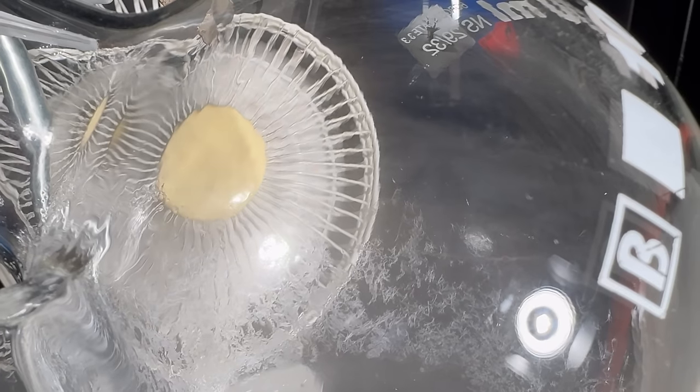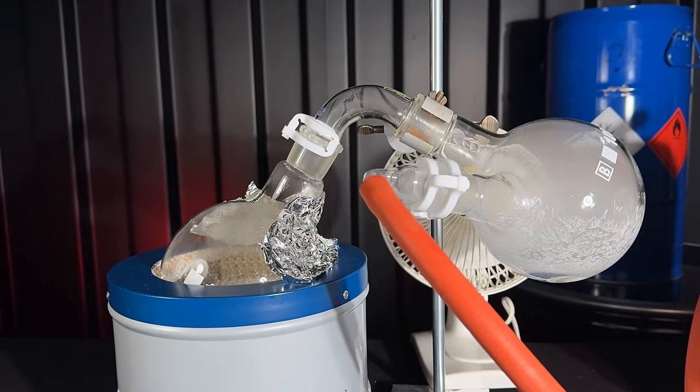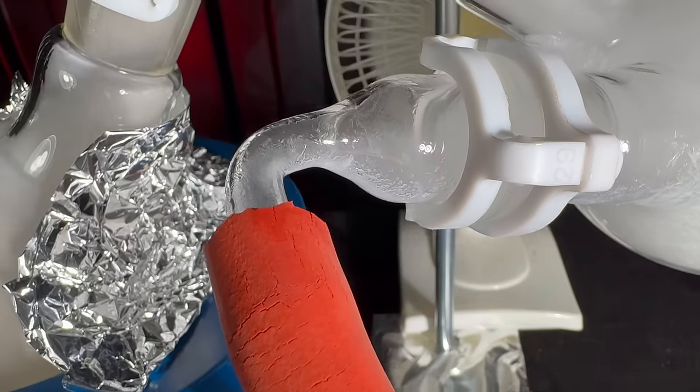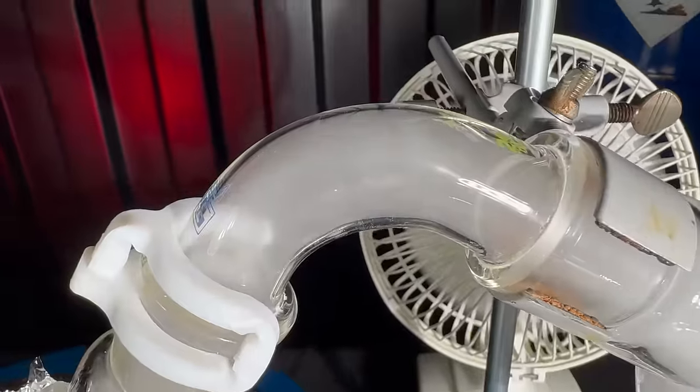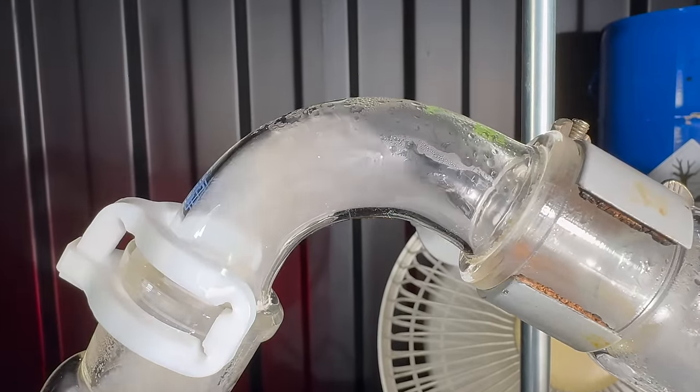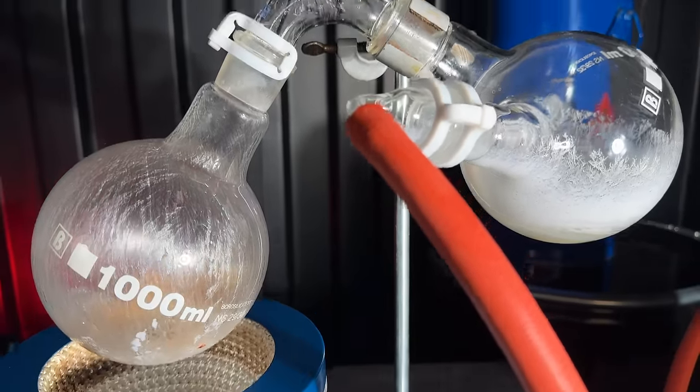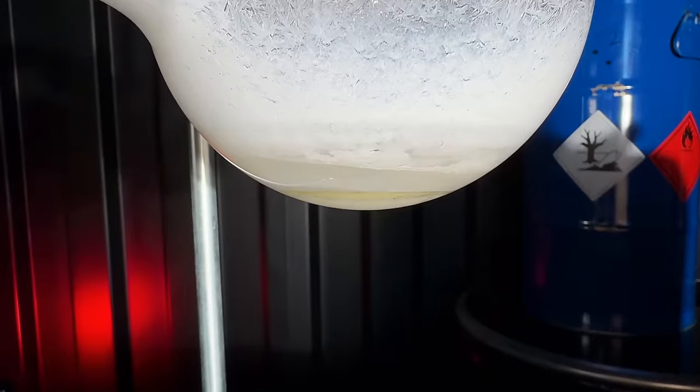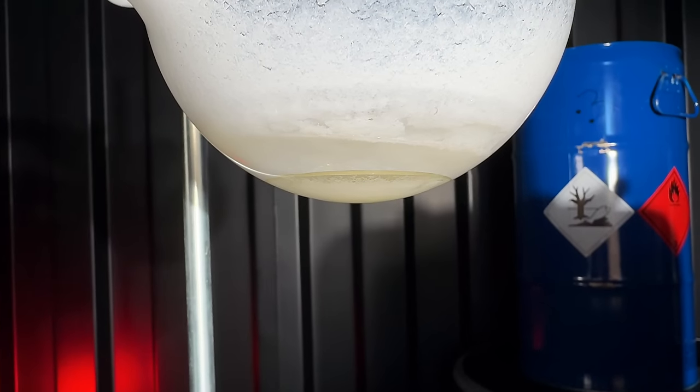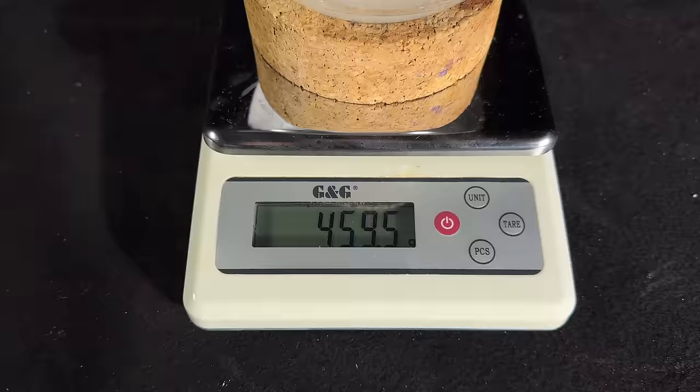The phenol cools down in the air, crystals form and you get this mesmerizing effect. It's like a snow globe in a round bottom flask. The entire decarboxylation took about 2 hours and in the end we were left with a decent amount of phenol. As I took a closer look at the flask, I noticed that there was solid floating around. I guess I didn't wash the salicylic acid well enough and this could be sodium chloride. Once the phenol generation ceased, I turned off the heating mantle. Here it's obvious how much leftover water there is. The next reaction step involving phenol will have additional water added and therefore I don't care. In the flask we were left with 119.7 grams of the purest phenol the world has ever seen.